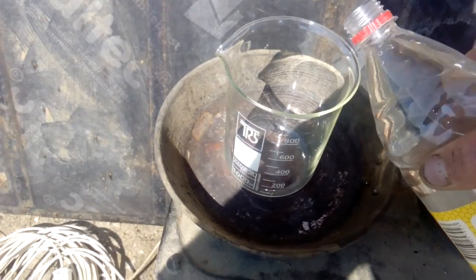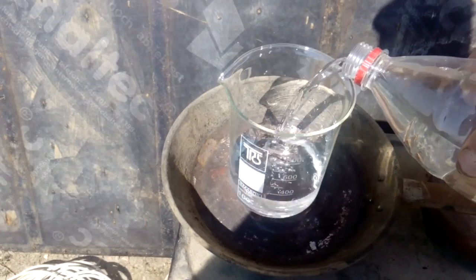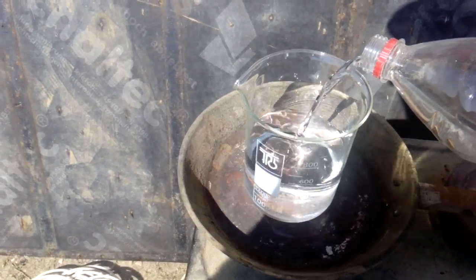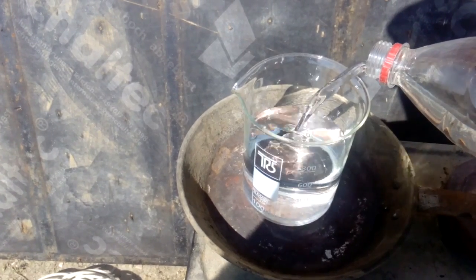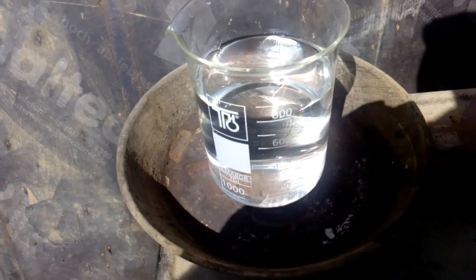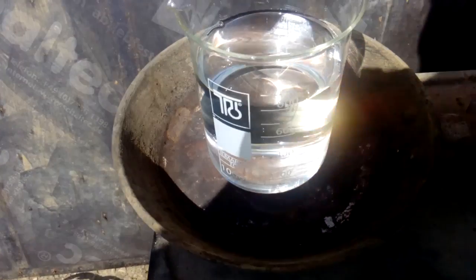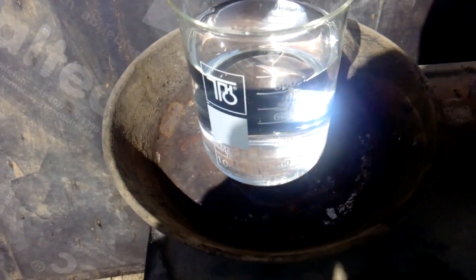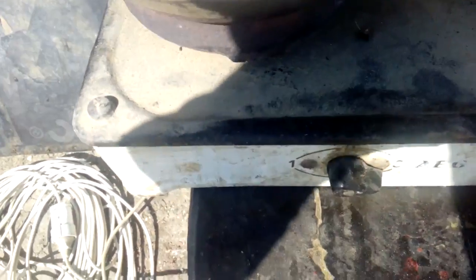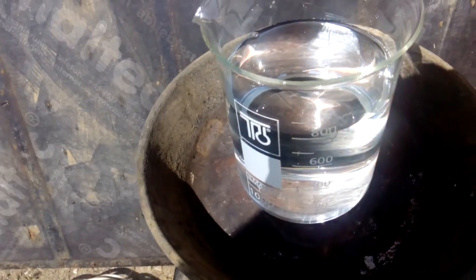Okay, now we're gonna slowly add acid into this one liter beaker. For the beginning I'll add about 800 ml and will add the rest when some amount of this liquid evaporates. I've already turned on some heat and we'll leave that for an hour or two.